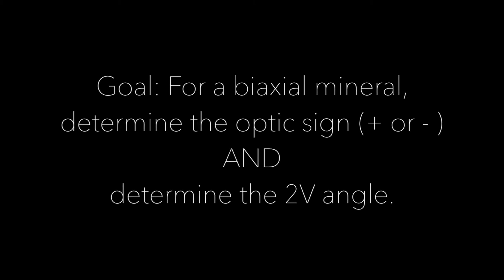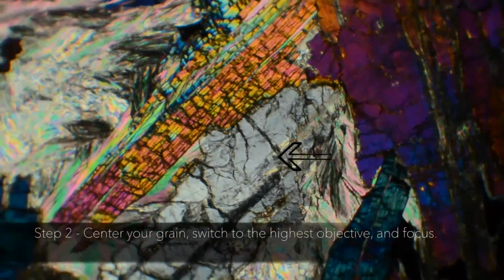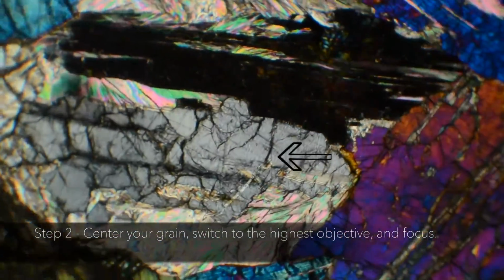Today we are learning how to describe and characterize biaxial minerals. Our goal is to determine the optic sign and the 2V angle for a given biaxial mineral. Step 1. In cross-polarized light, pick a grain with low retardation of a given mineral. Step 2. Center your grain, switch to the highest objective, and focus.